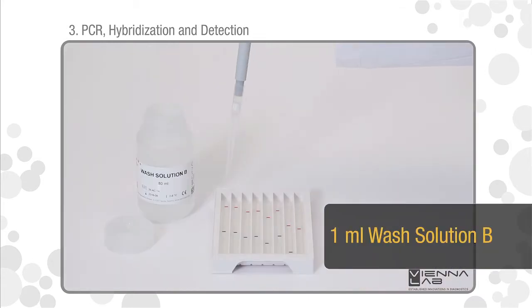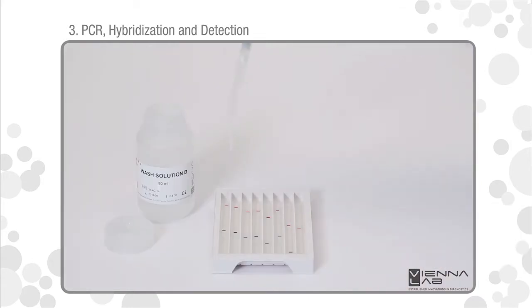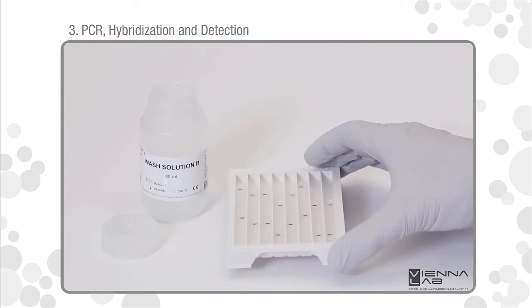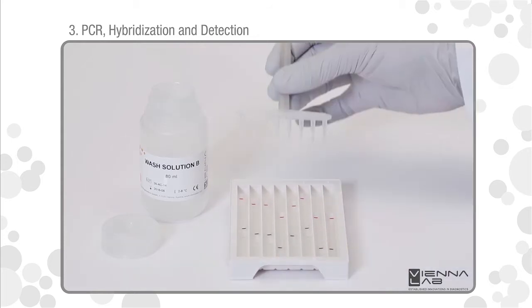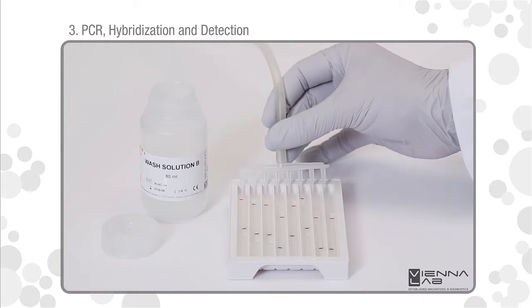Add one milliliter wash solution B. Rinse briefly. Remove liquids by vacuum aspiration.